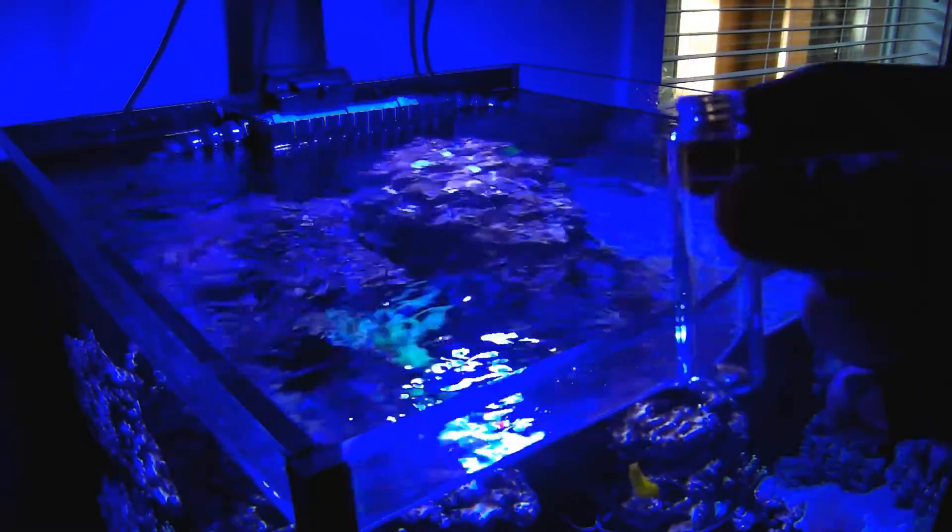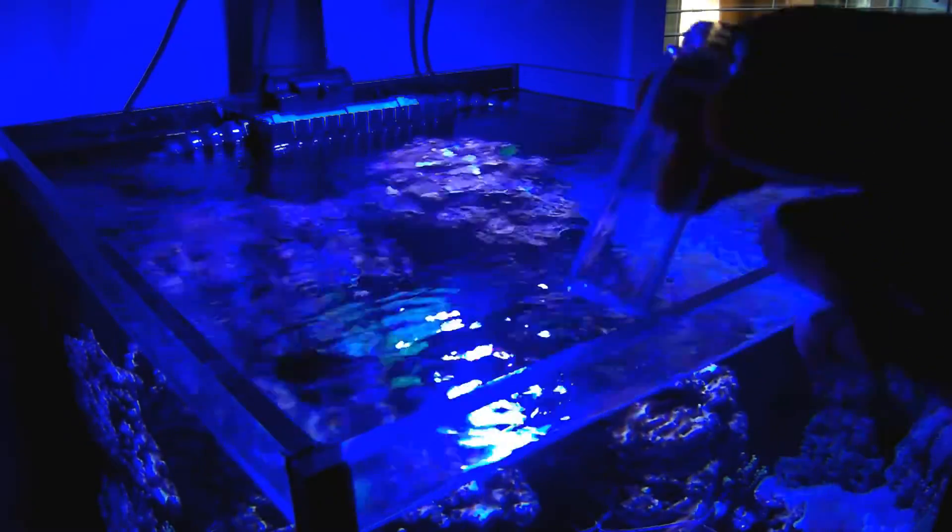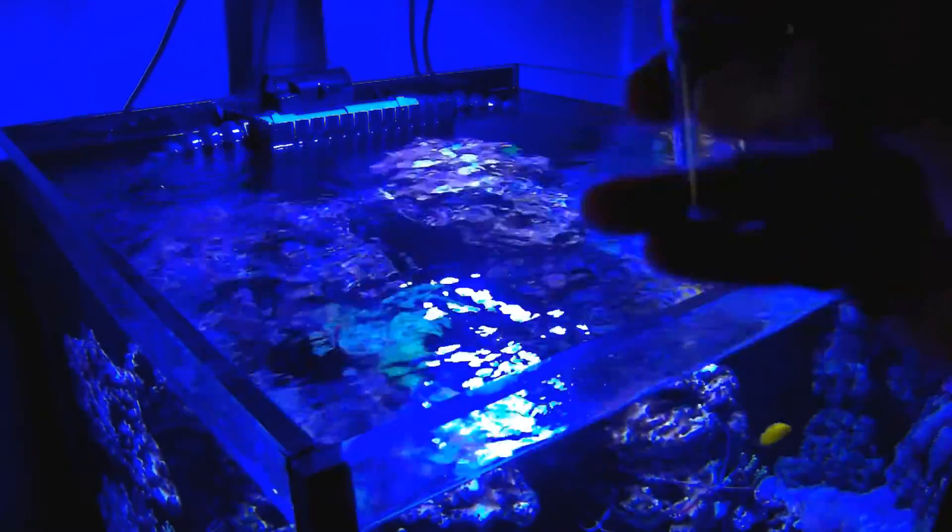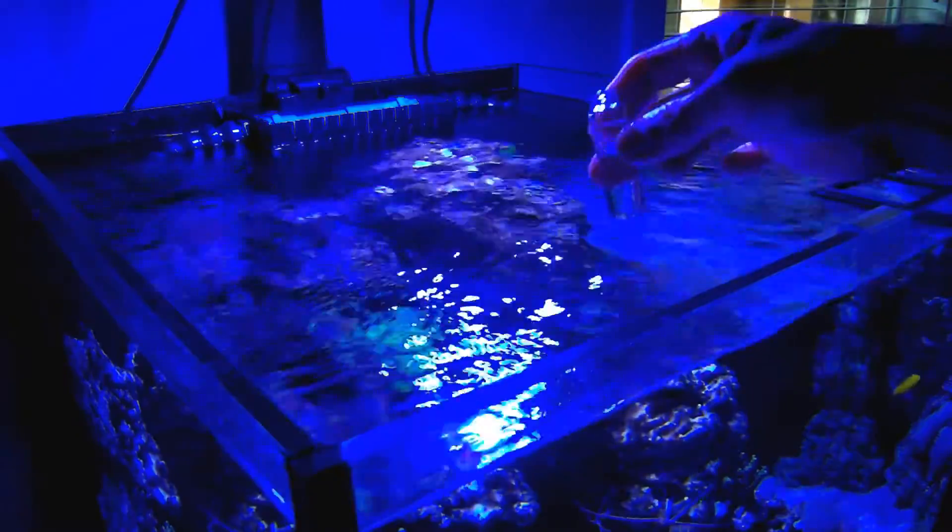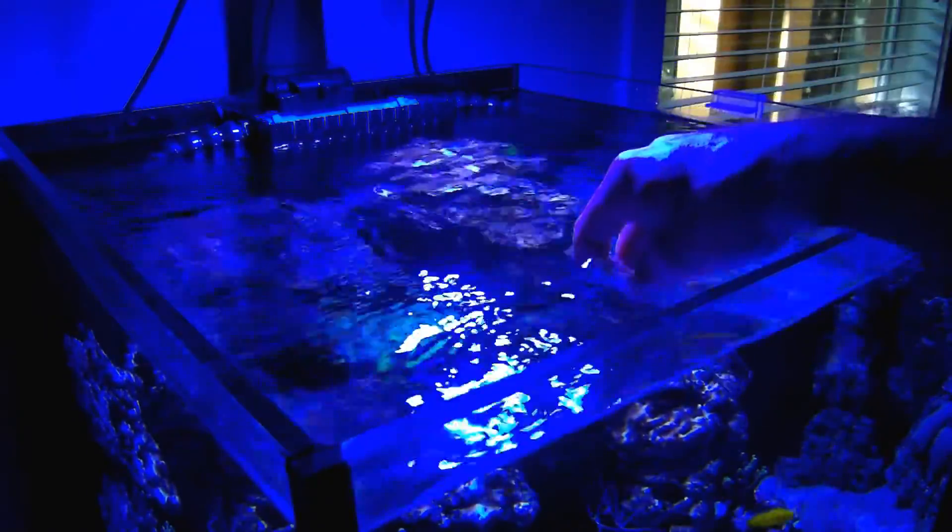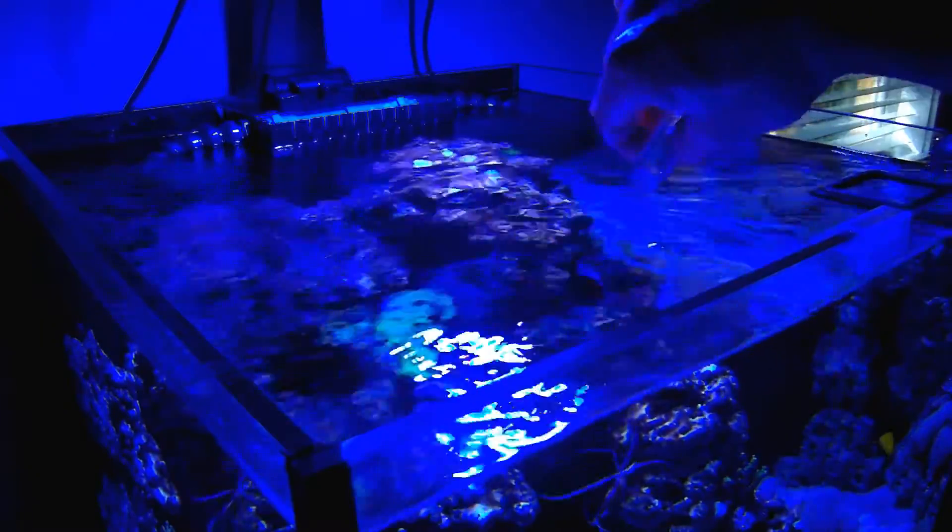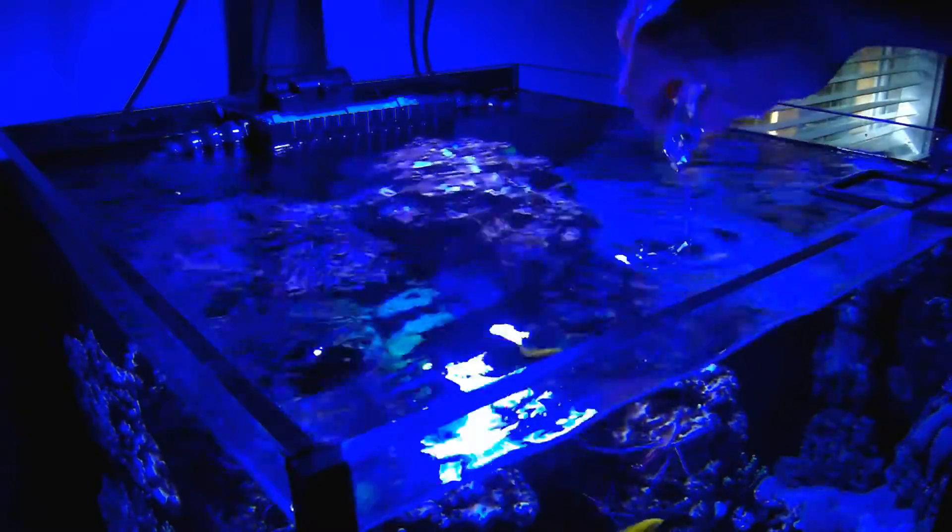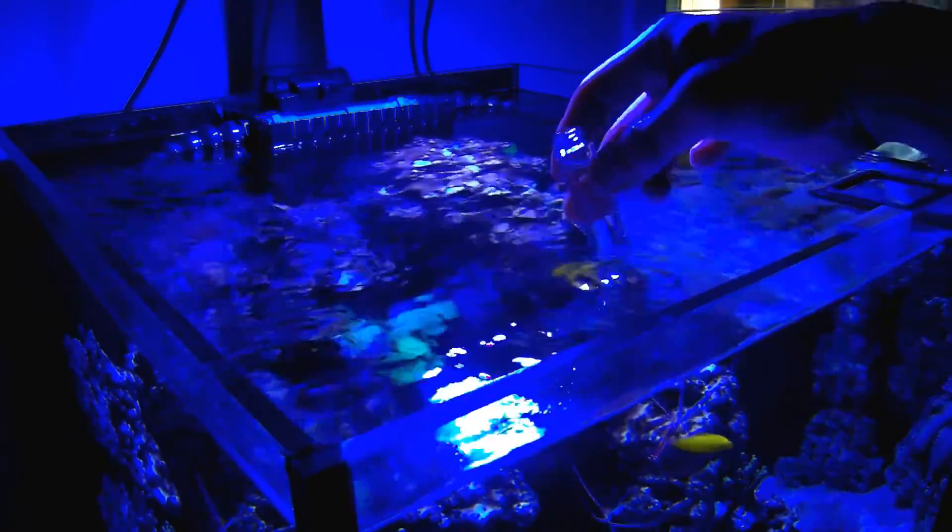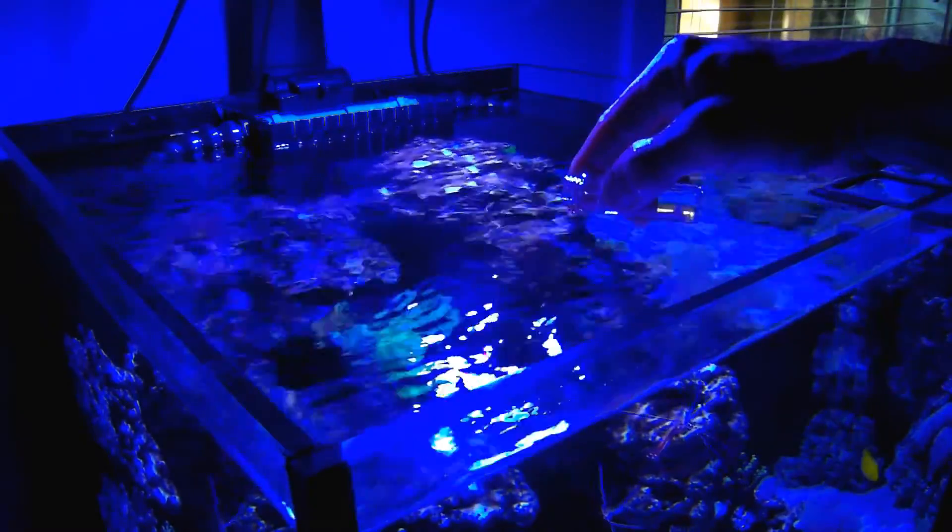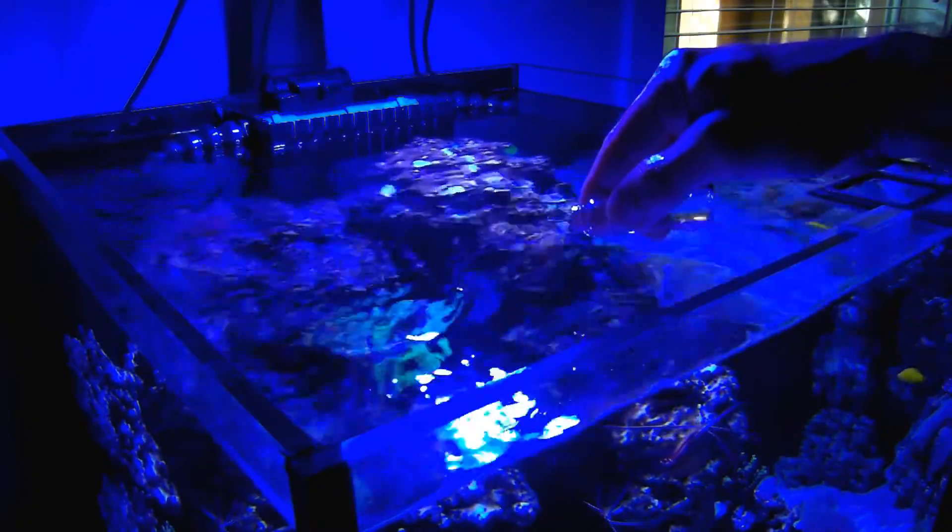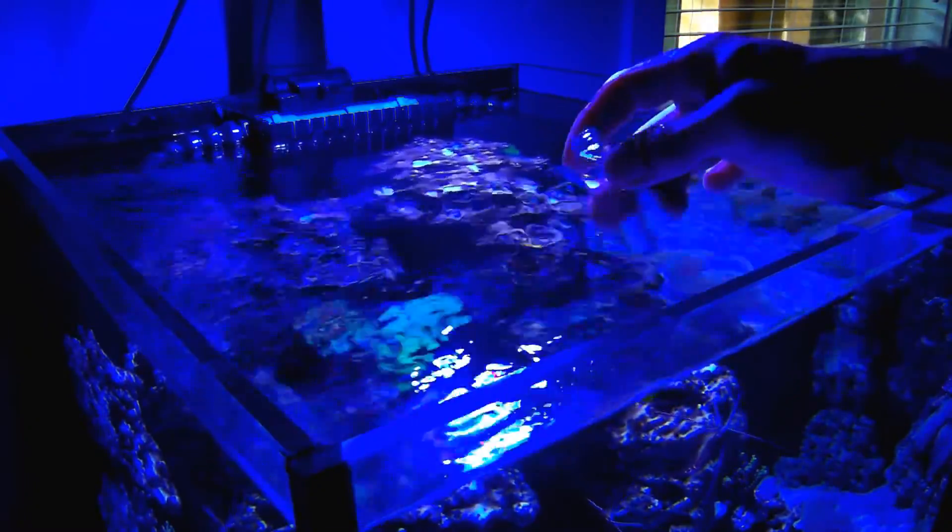Now with one of the glass cuvettes, I'm going to get 10 milliliters to the line here, 10 milliliters of aquarium water. I'm going to rinse it first a couple of times, make sure there's no dust or debris or anything to affect the result.